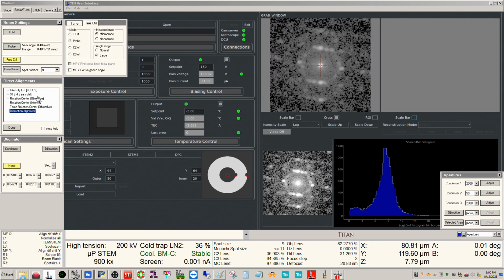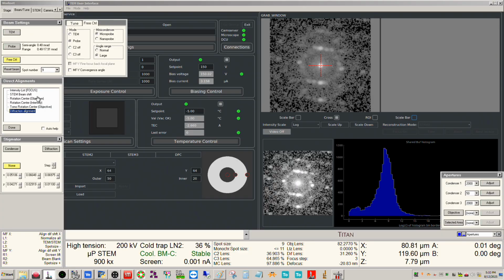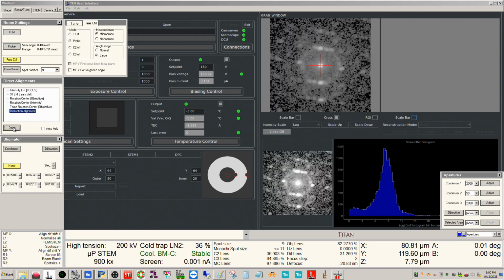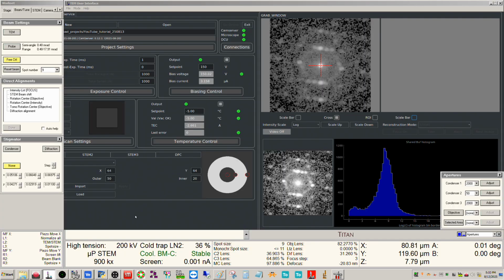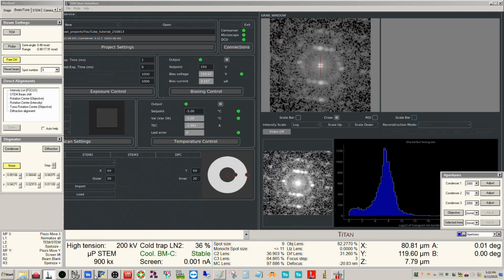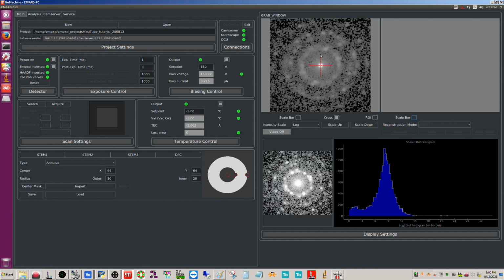Okay, but you want your direct disk centered as well as possible. As I mentioned previously, there is one thing you want to be cognizant of. So actually, let me start the scan in Velox, even though we're not going to see it. But let me go ahead and start it. Okay, so you can see it scanning now.